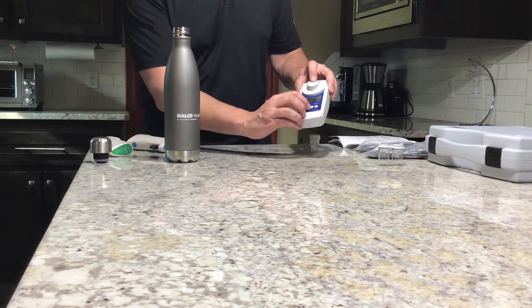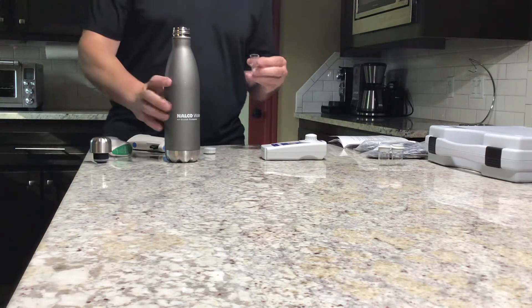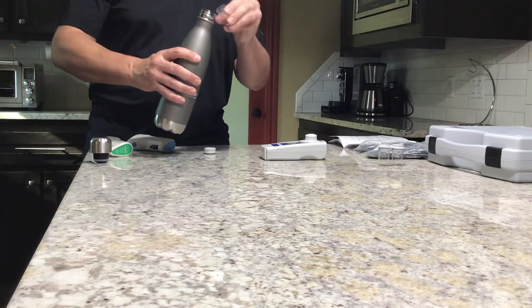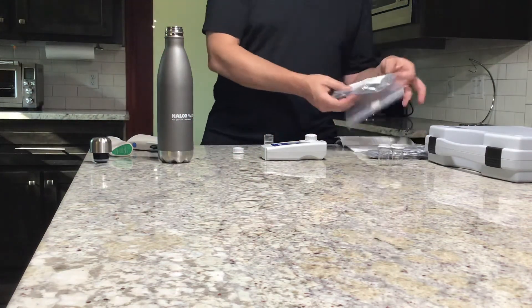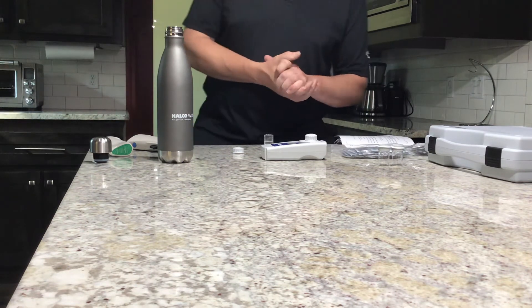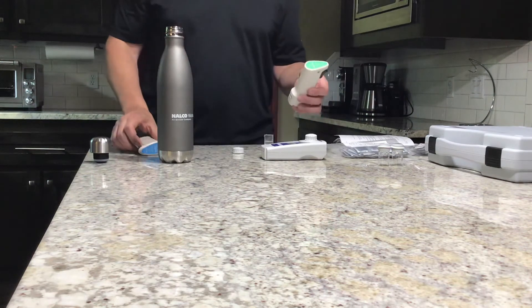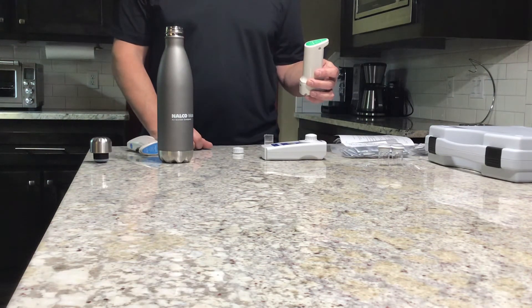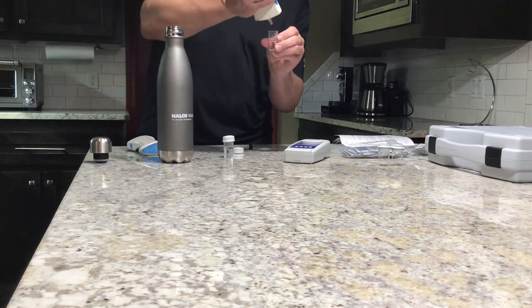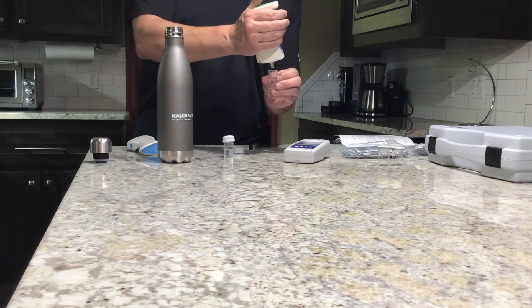The first step is to zero it out — press the zero/test button and it's going to blink a few times. In a real scenario, we're letting that water run while it zeros. Then we take our 5 milliliter sample and fill it up to that line. Now we can use either the pillow packs or the DPD swift test dispensers for taking a free or total chlorine sample. In this case it's a monochloramine sample, so we're going to take a total sample using the green DPD swift test dispenser. For the high range, we take two dispensations — if it were the low range we would just use one. So we do two squeezes.